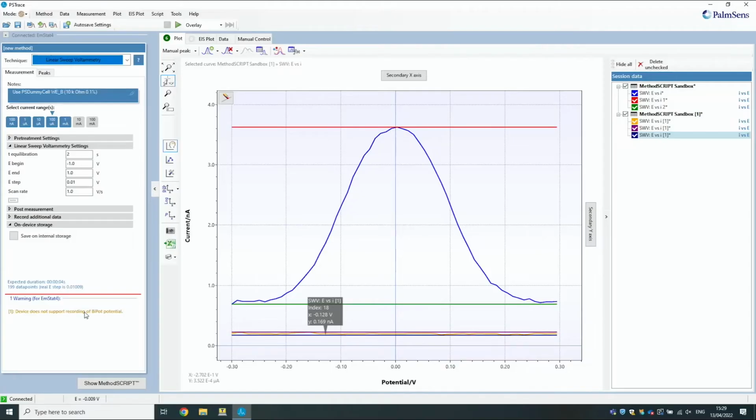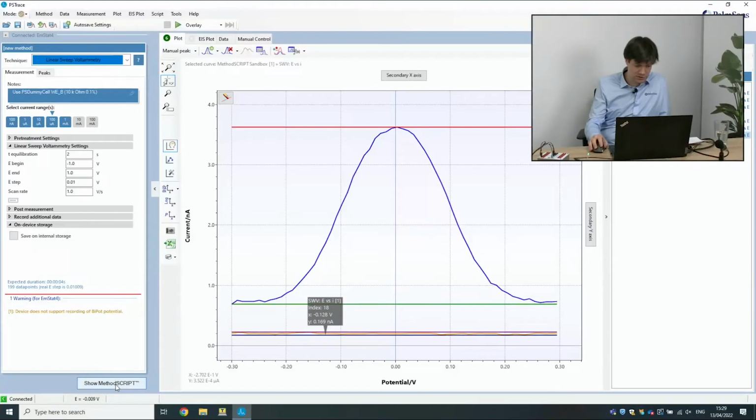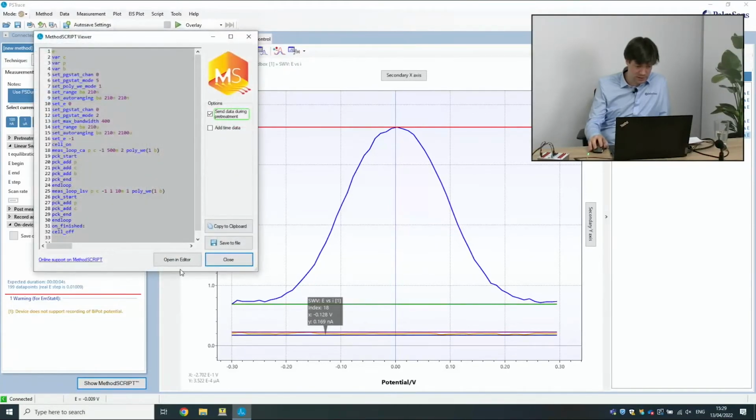Yeah, can MethodSCRIPT, Hielke, also be used as a method to do multiple measurements after each other? So, for example, first an LSV and then afterwards a CA measurement. Is that possible? Yes, in fact, let's show this in PSTrace right now. So this already happens in PSTrace. This is just a random CA or LSV measurement. Let's show what the script does.